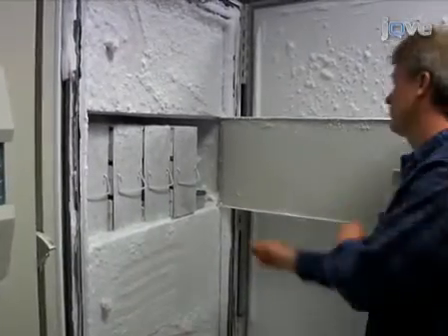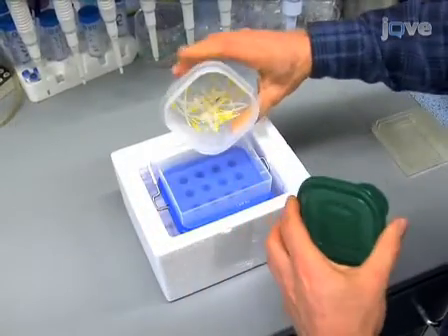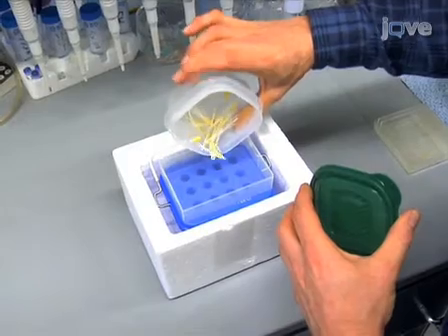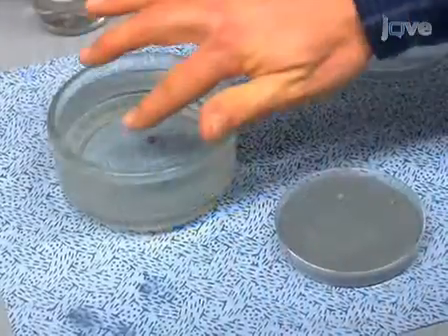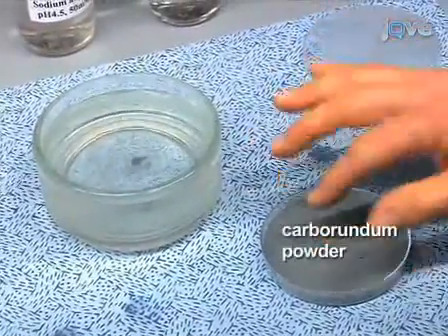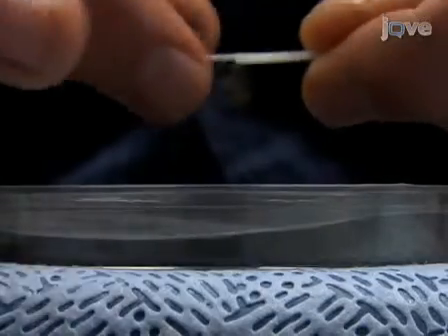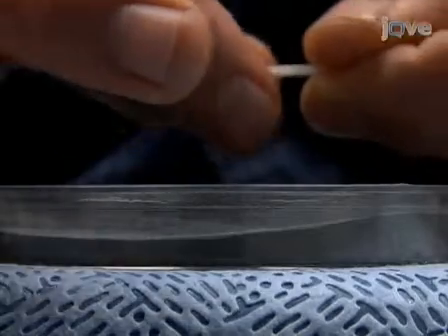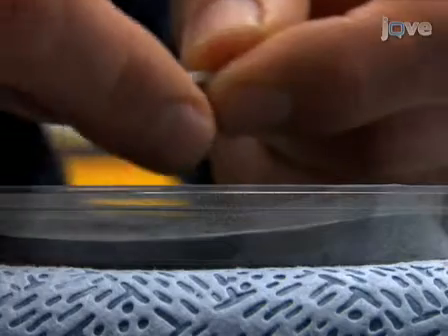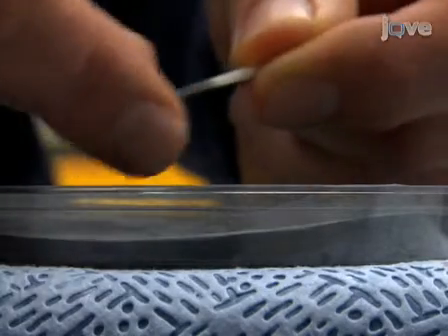To begin preparing cell wall samples, small groups of 8 to 10 frozen seedlings are transferred from the freezer to an insulated container containing a -80 degrees Celsius freezer block. Using a thick slurry of carborundum powder to coat the thumb and forefinger, the cuticle covering of the hypocotyl is removed by repeatedly drawing the hypocotyl between the thumb and forefinger. While performing this technique, it is critical to use the correct amount of pressure that will ensure permeabilization of the cuticle without damaging the epidermal layer.